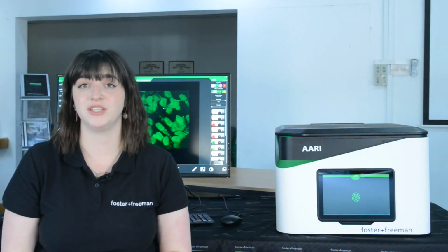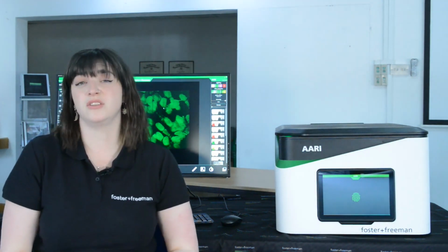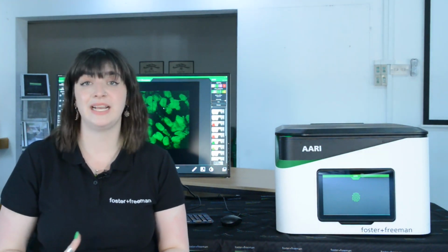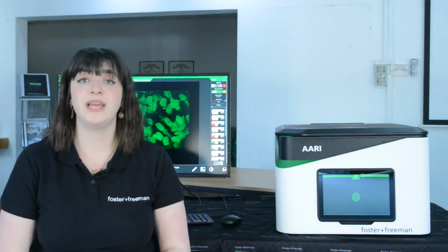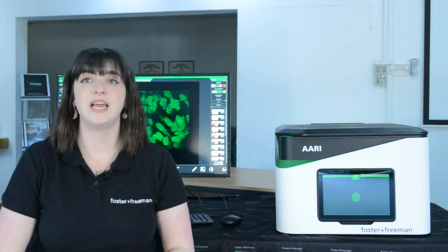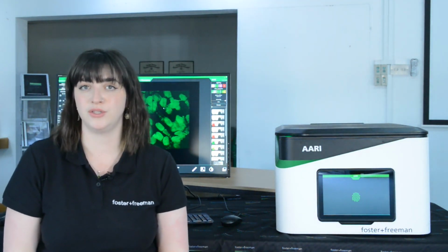Alongside AARI, we launched our Amino Acid Validation Targets. And these are basically to check that our solutions are functioning as intended. So we have two tests that basically mimic a normal fingerprint or a standard expected fingerprint and a much weaker trace. So hopefully what will happen is when these test strips are treated alongside our evidence is that both tests will develop and then we will know that our solutions are working as intended.